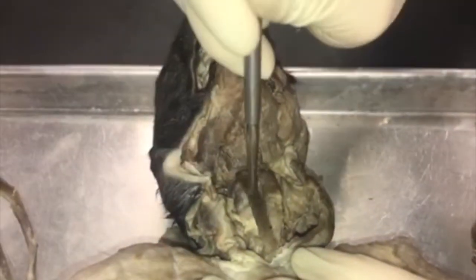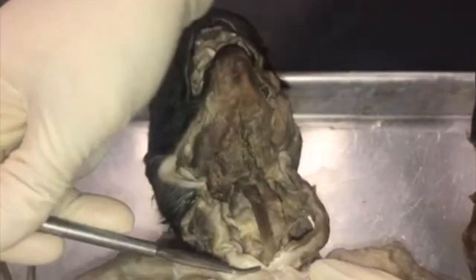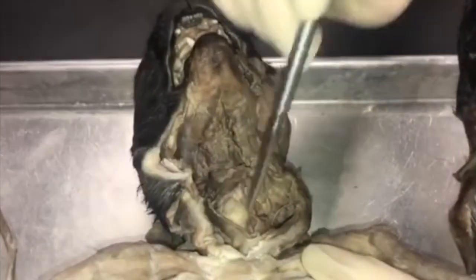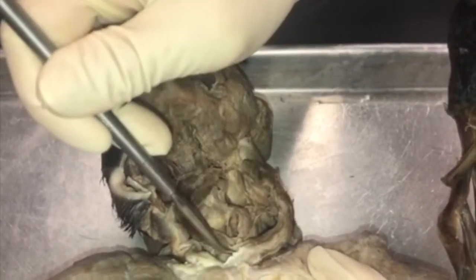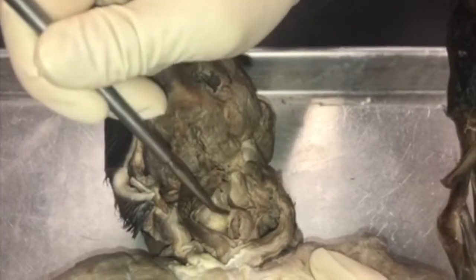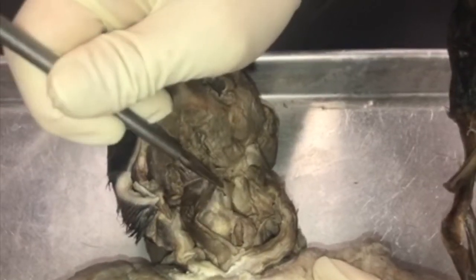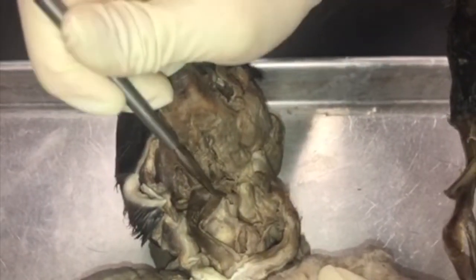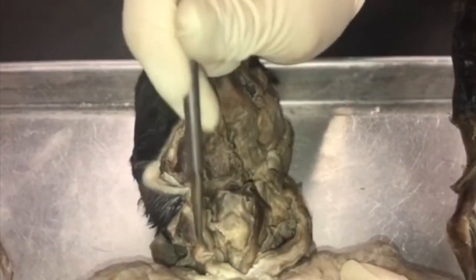These two muscles — you have one on each side, just like we had with the digastric muscles — are going from your sternum to your hyoid, so they're going to be your sternohyoid muscles. If you pull that to the side, you can see there's a muscle right here going from your sternum to your thyroid, known as your sternothyroid. Right above that, a very small muscle is running from your thyroid to your hyoid and is going to be known as your thyrohyoid muscle. Both of these can also be found on the other side of the cat as well.